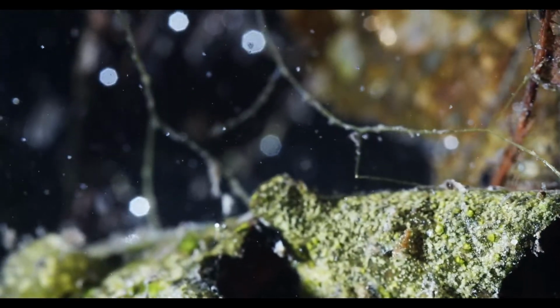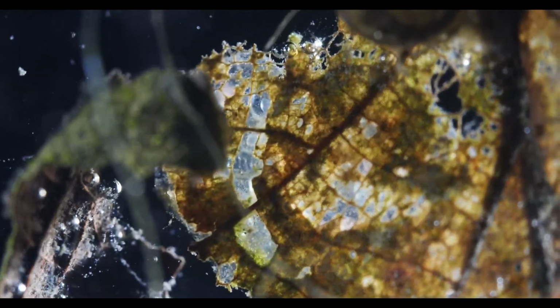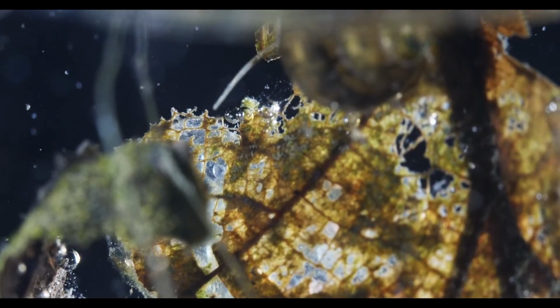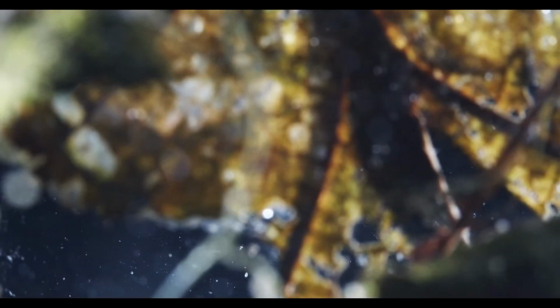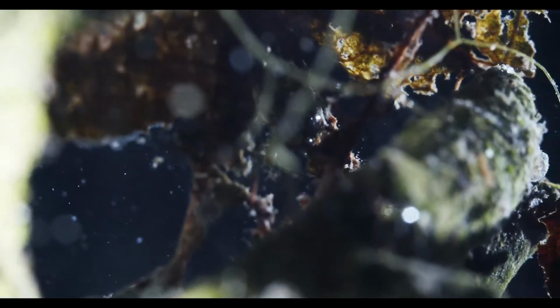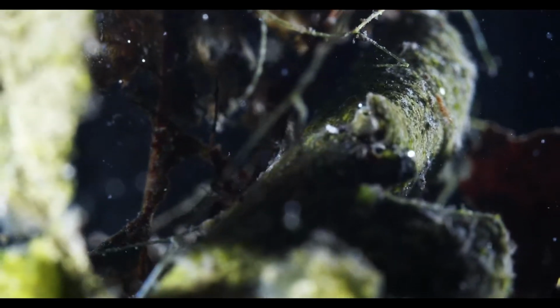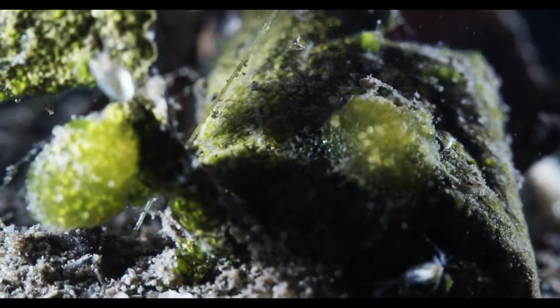Sneaking. Oh, out of focus. So, I don't know, what do you guys think? Should I change lenses real quick and we'll try to find some of these critters and get a closer look?